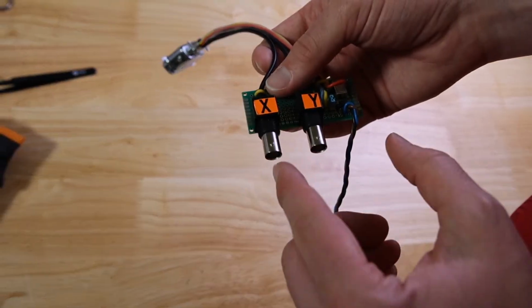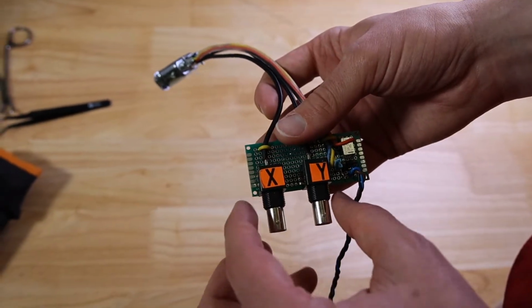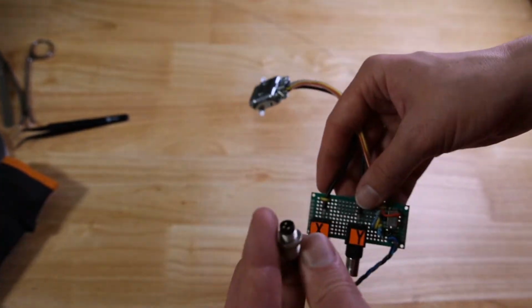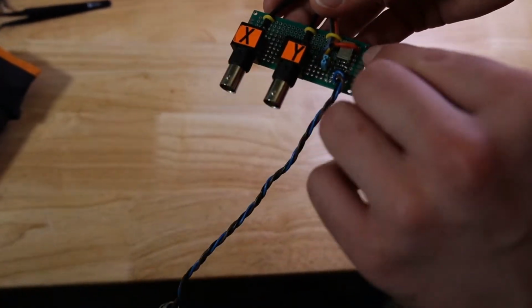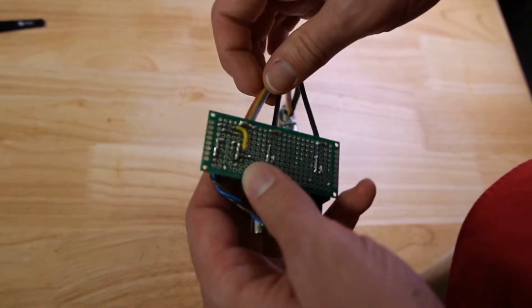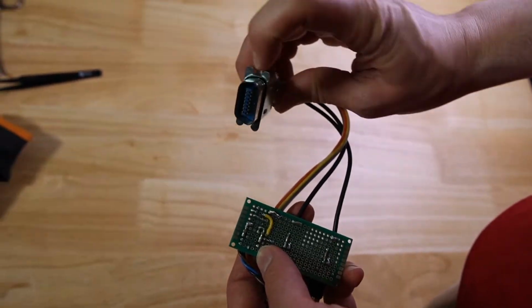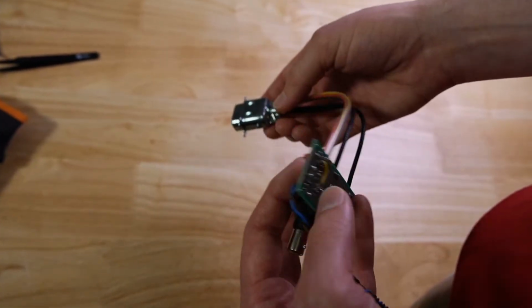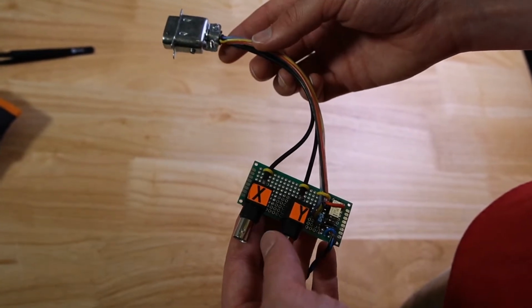So we've got two BNCs. These take the X and Y signal from OBI and put it into the JA7 connector. And then this M8 connector flips this relay. The point of this relay is that it shorts together two pins on this connector, and when those particular two pins are shorted, that tells the microscope to flip over to external scan.